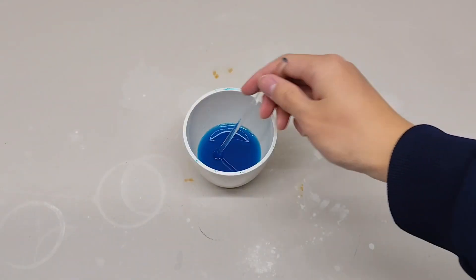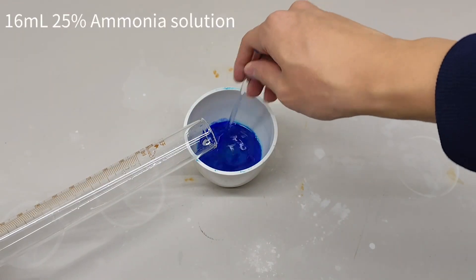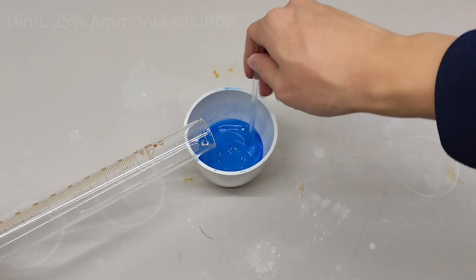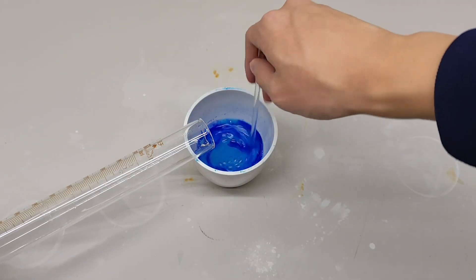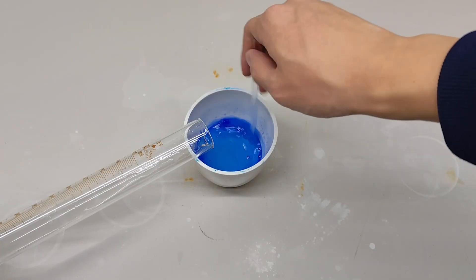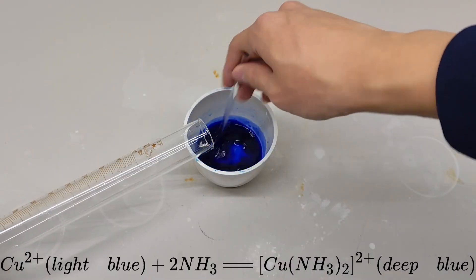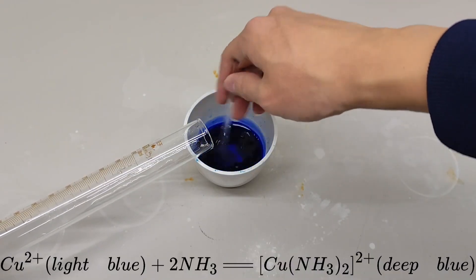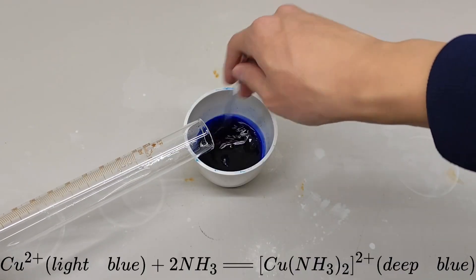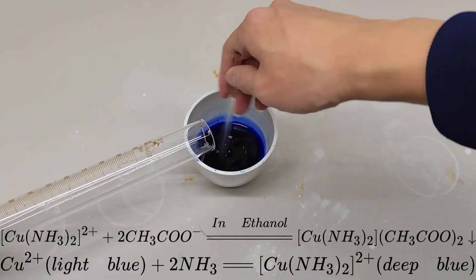A few minutes later the reaction is done. I then add 60 milliliters of 25% ammonia solution slowly and stir for half an hour. As the ammonia solution is added, the blue color of the solution gradually deepens, because diamine copper ions — a deep blue species — are formed. If ethanol is added to the solution at this point, deep blue diamine copper acetate, a beautiful crystal, will precipitate.